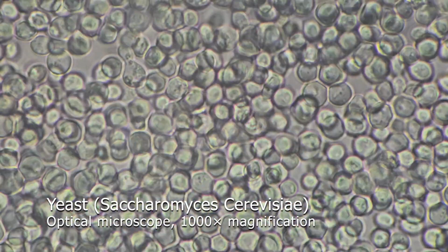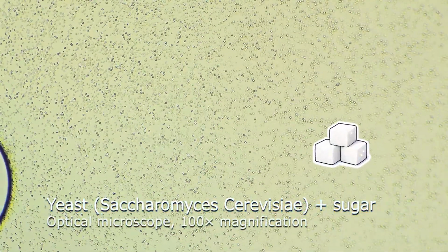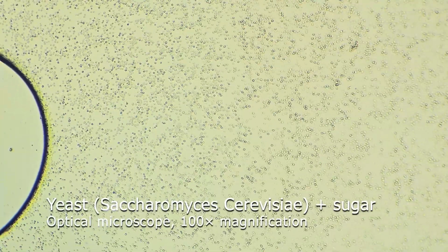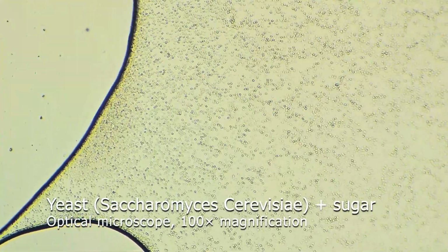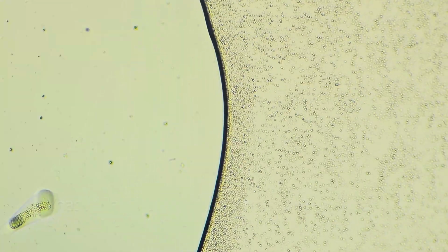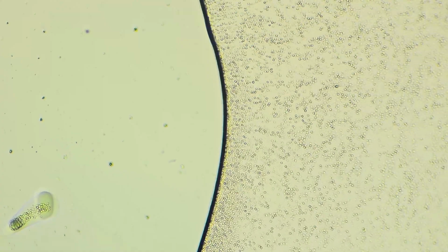In plain water, however, nothing particularly interesting happens. The yeast is present, but it does not yet have access to an energy source. For comparison, I prepared a second sample. This time, I added a little sugar to the yeast. Yeast uses sugars and produces carbon dioxide, which makes bread rise and become fluffy.